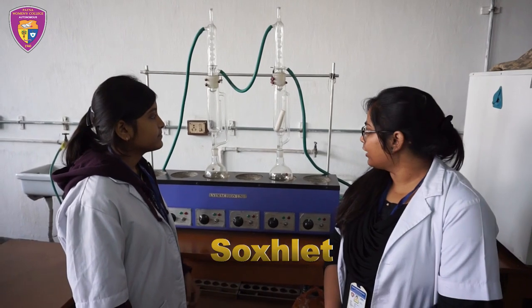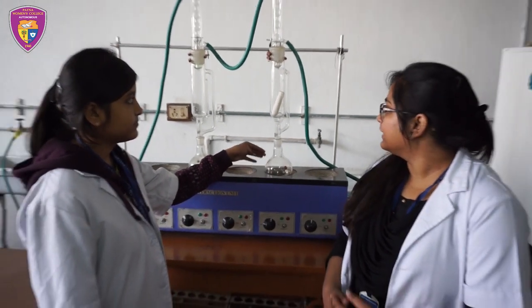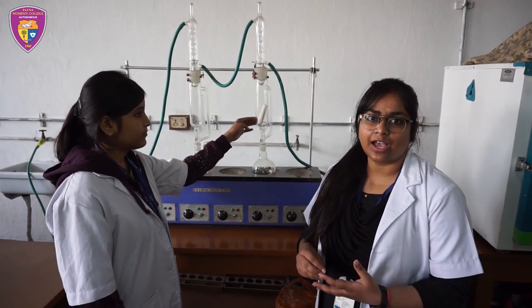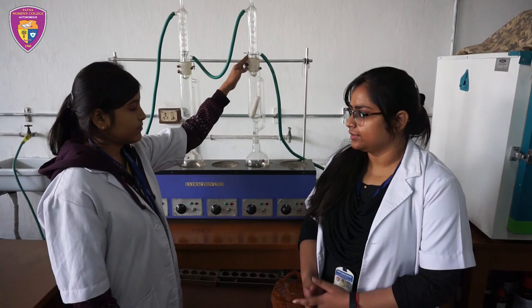In the round bottom flask we have petroleum ether as solvent, and in the siphon tube we have taken a thimble in which we have put our sample, and above it is a condenser.